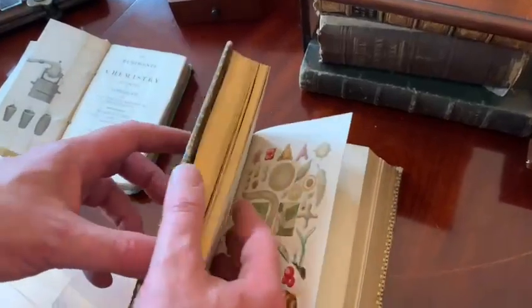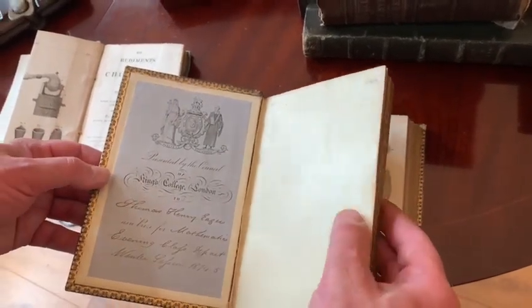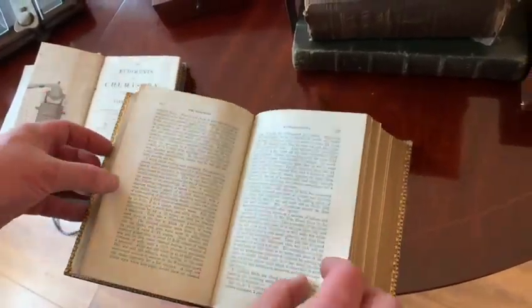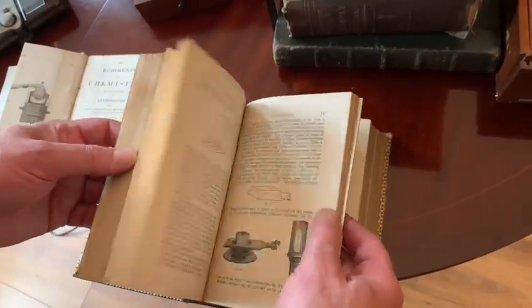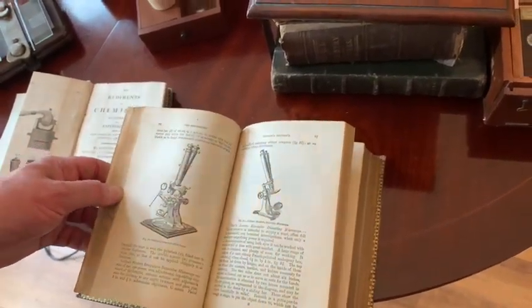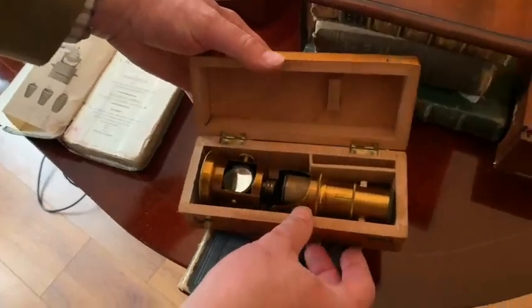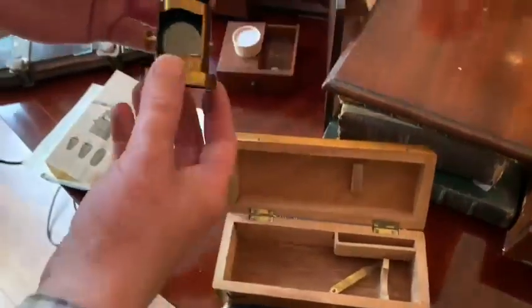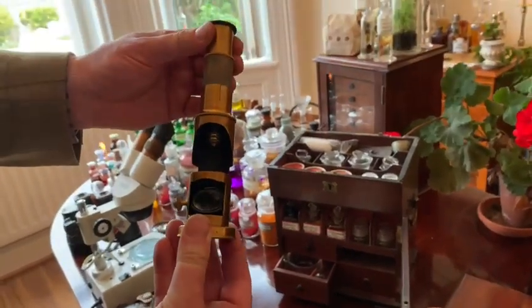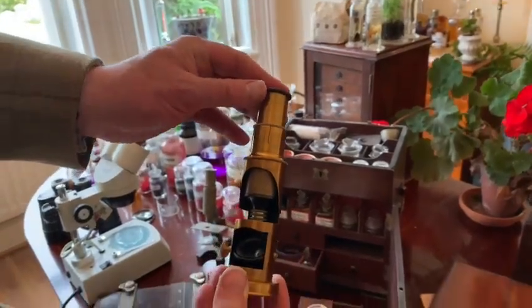If you're interested in microscopy, I have a lovely little book here from around the 1860s, written by a man called Hogg. As you can see, it was presented to a man at King's College London all those years ago. It has some beautiful plates, but it's not just a beautiful book — it's actually very useful because it covers the beginnings of microscopy when it was a hobby and explains the principles of it. It shows some very beautiful instruments which somebody with a lot of money could perhaps still pick up on Portobello Road in London. I was able to pick up this little microscope very cheaply — it's a little hobby microscope and it comes with a little travelling box, exactly as it would have been used by someone in the Victorian era who wanted to go and look at ferns or something under the microscope in the field.